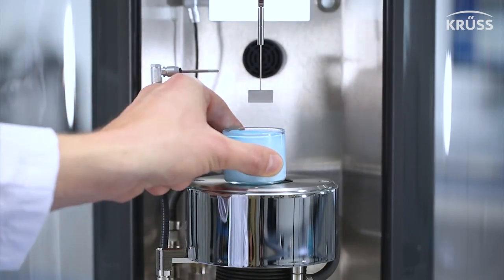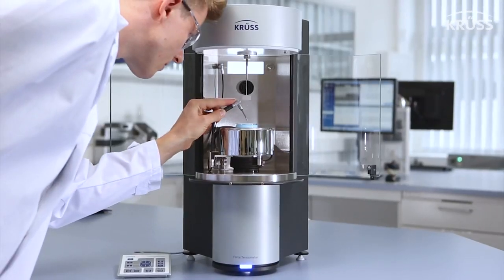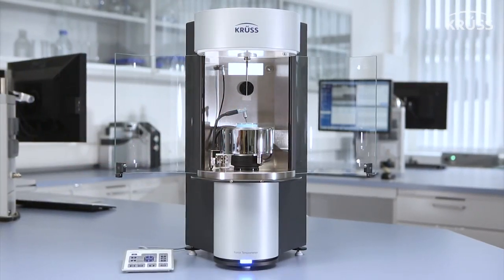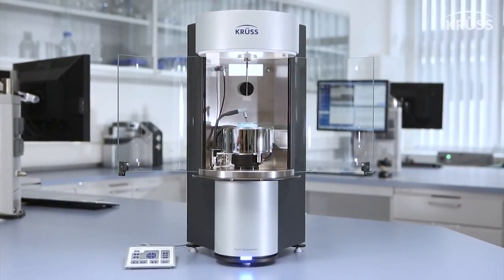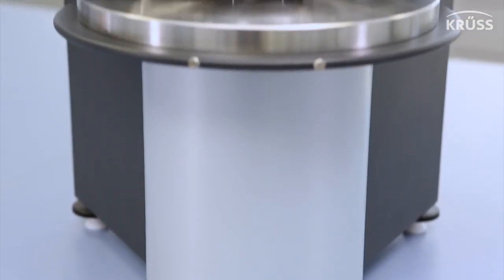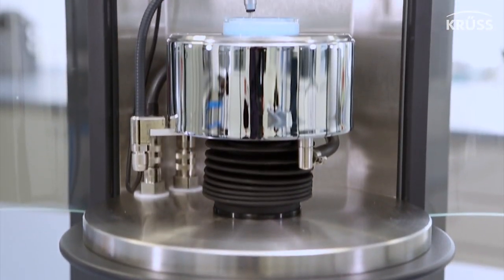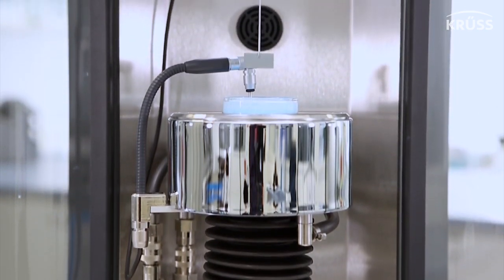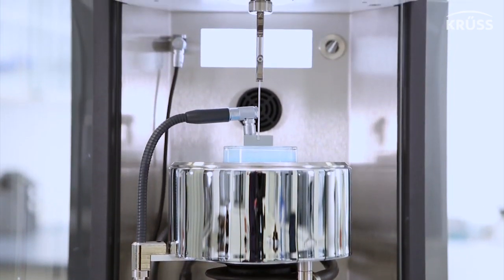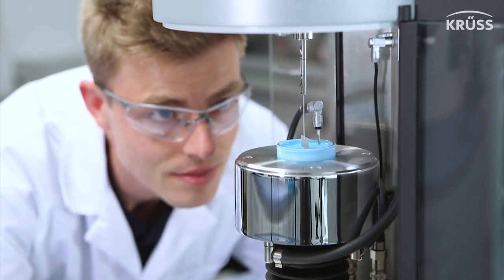The K100 features a force sensor with a very high resolution, able to detect force changes down to 0.001 micronewtons. In combination with the sample stage, which has a precision of 0.1 micrometers using a smoothly running servo motor, even the smallest surface and interfacial tension differences are measurable.